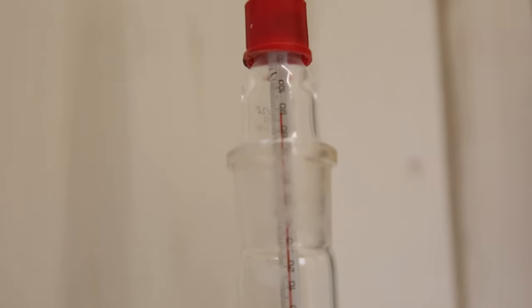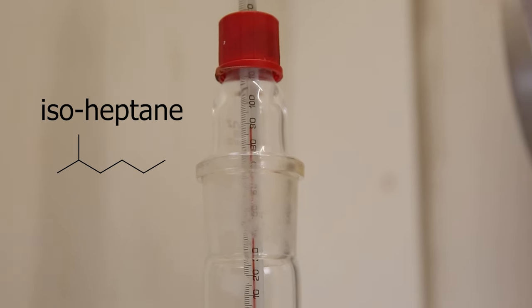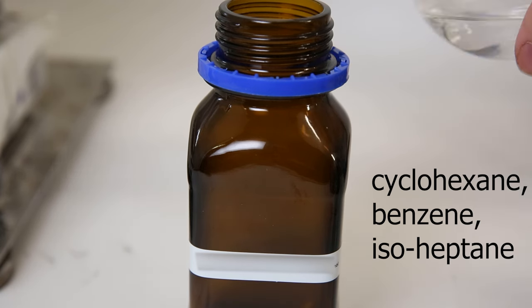Afterward, the temperature increased to 90°C, which corresponds to iso-heptane. After that was finished, I emptied the receiving flask back into the bottle.